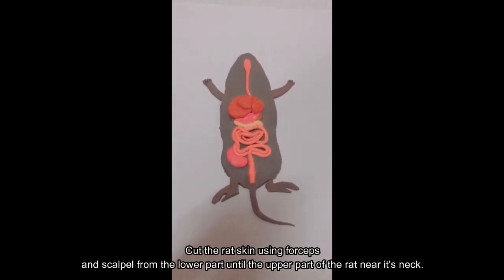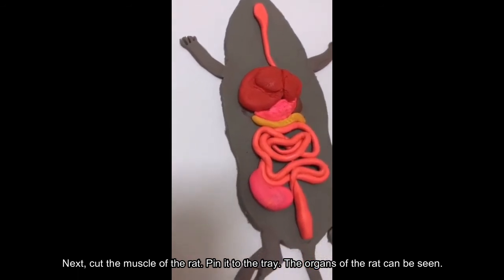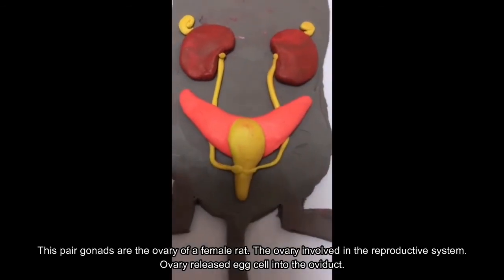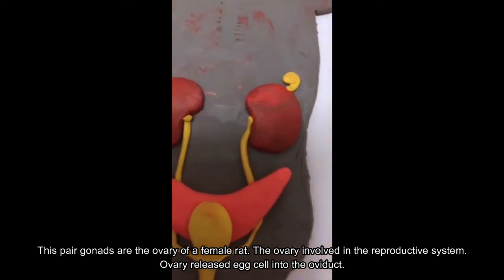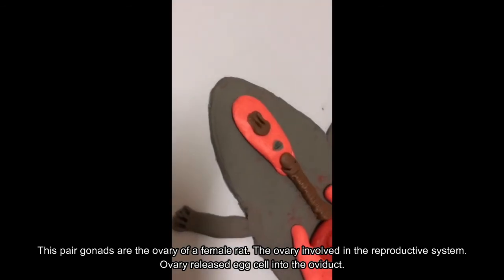The rat skin is cut using forceps and scalpel from the lower part until the upper part of the rat near its neck. Next, the muscle of the rat is cut and pinned to the tray. The organs of the rat can be seen. These paired gonads are the ovaries of the female rat. The ovaries are involved in the reproductive system, where the ovaries will release egg cells into the oviducts.